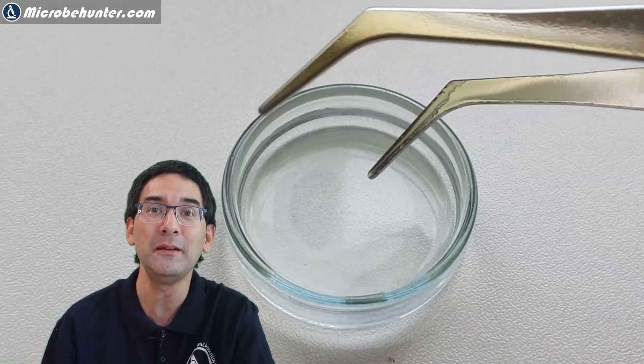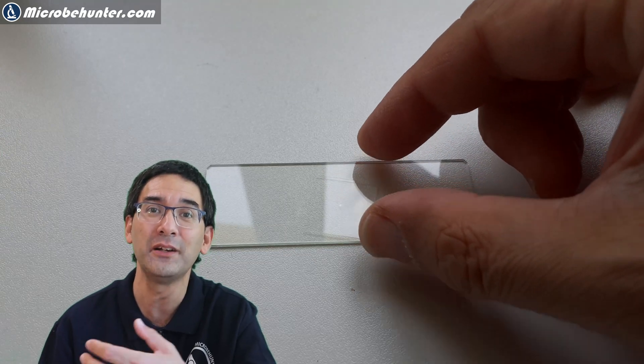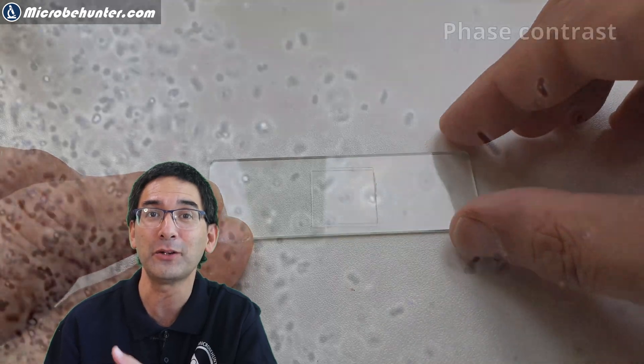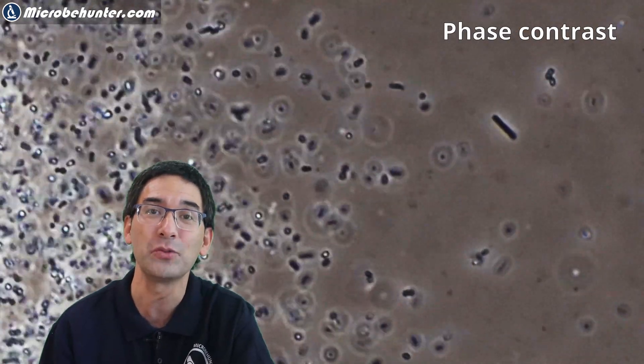I'm adding here again a little bit more because it was not concentrated enough. But this is indeed a method that I recommend, because the bacterial concentration is quite high. You only see bacteria — you do not see any other cellular material that might distract. And as a matter of fact, you're also able to see different bacterial shapes this way.